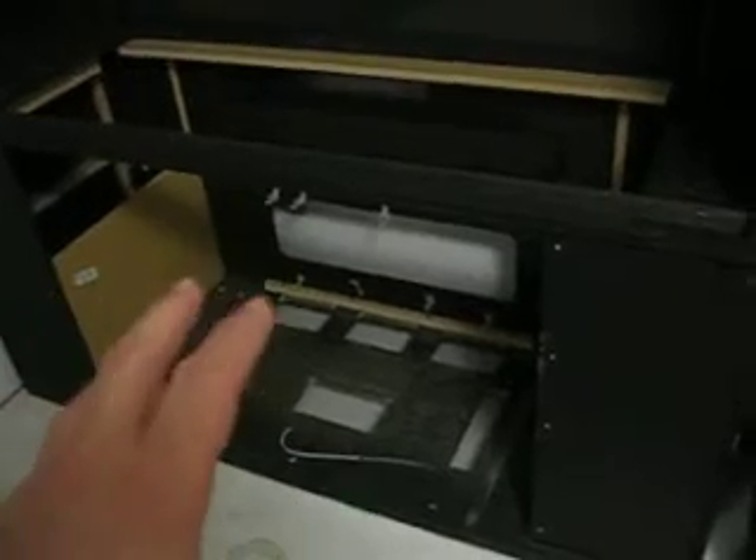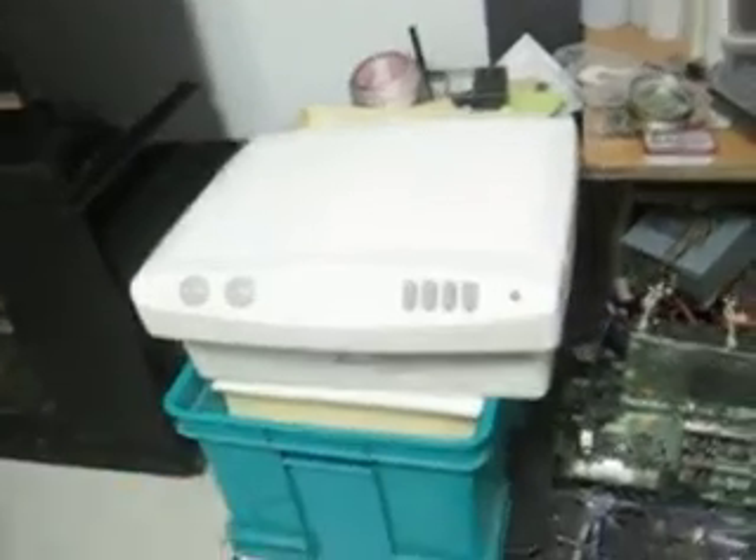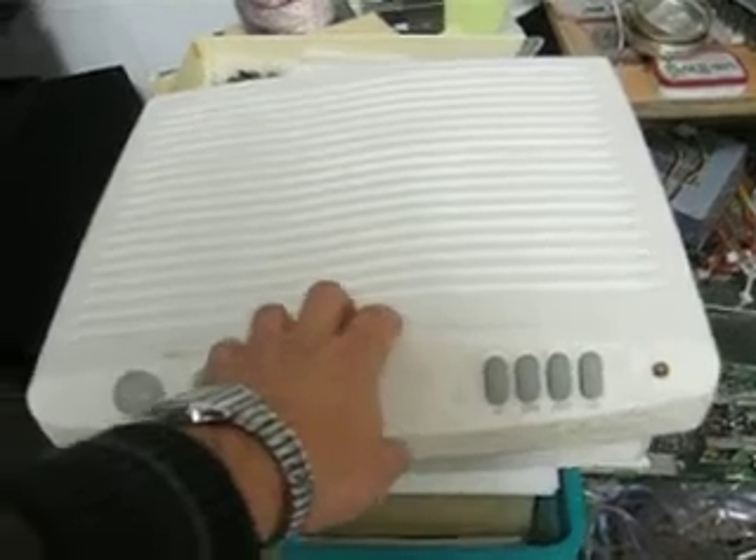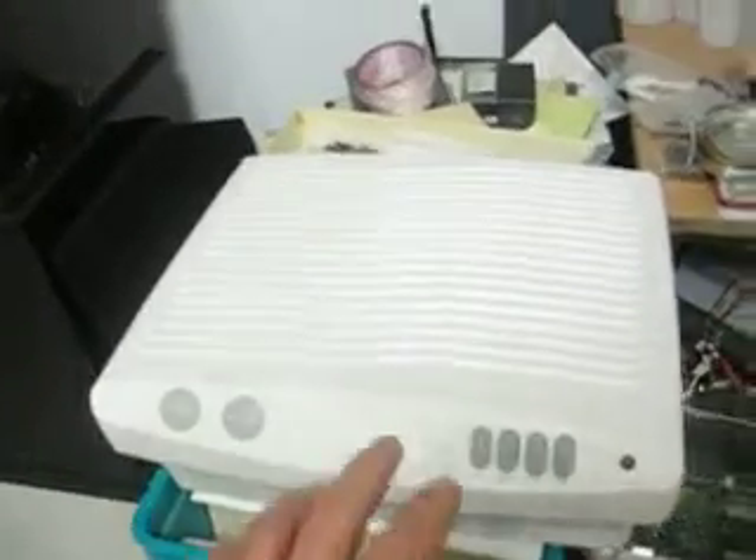Whereas the other side, as you can see, there's a hole there, but most of the back is pretty solidly enclosed. I got the big screen TV — it wasn't working, I got it for free, just the fuel to go pick it up and the back strain. I picked up a cheap HEPA air filter for three and a half dollars at Goodwill, and I'm going to put that in there and get this all set up.